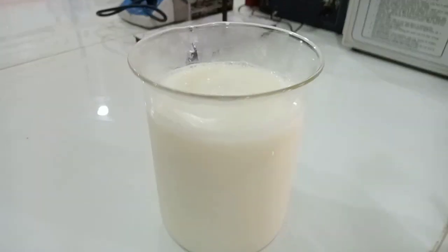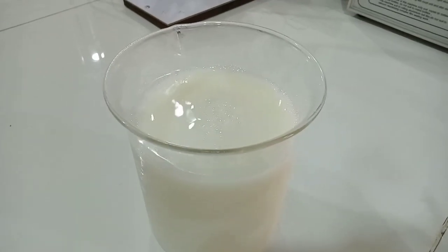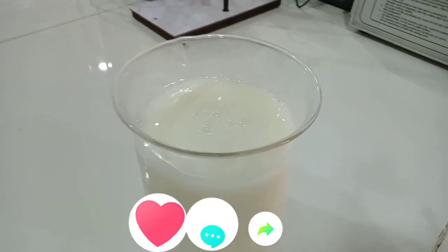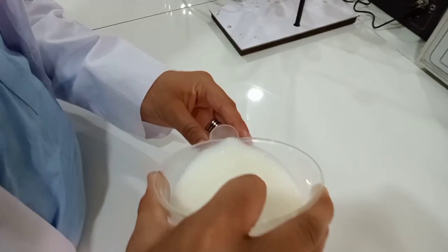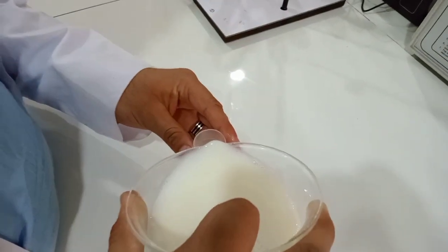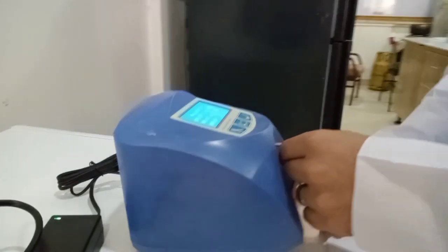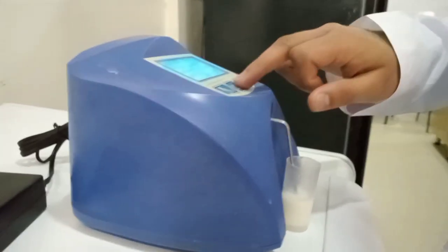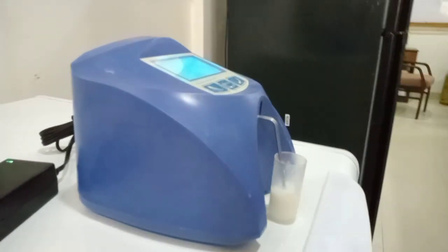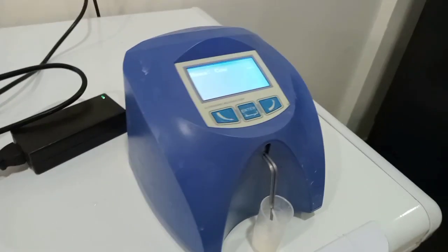First of all, homogenize the milk and then pour it into a small tube. The tube will be placed under the milk analyzer machine.